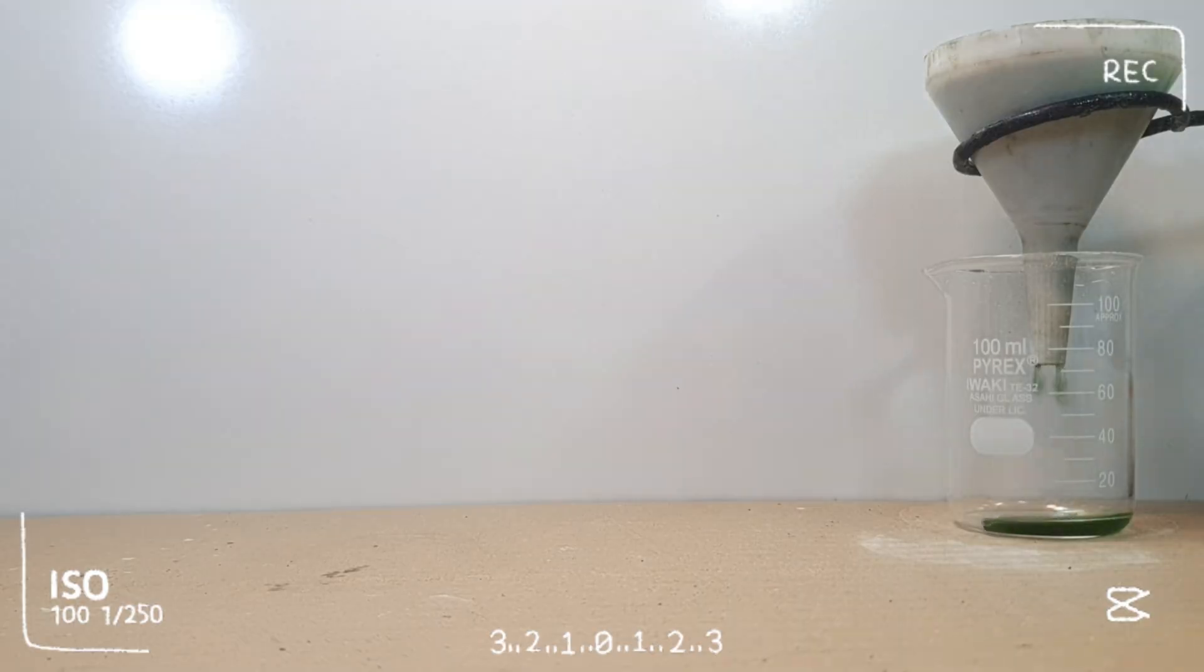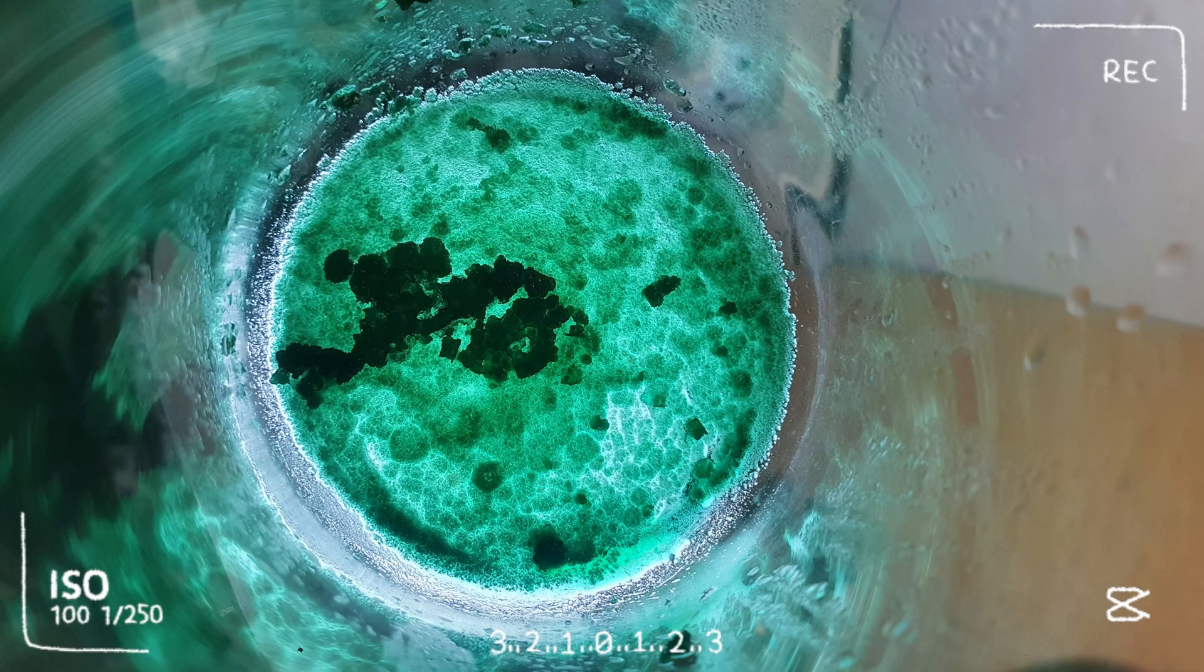In the previous video, I demonstrated how to extract cadmium from nickel cadmium batteries. In this video, I'll show you how to extract nickel from these batteries. So let's start the video.